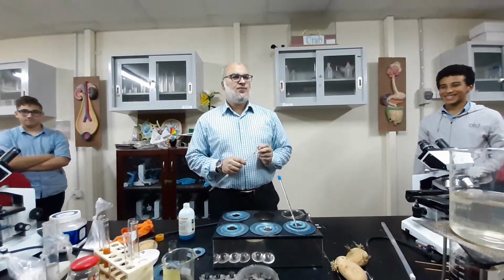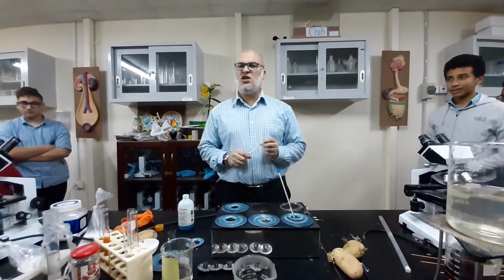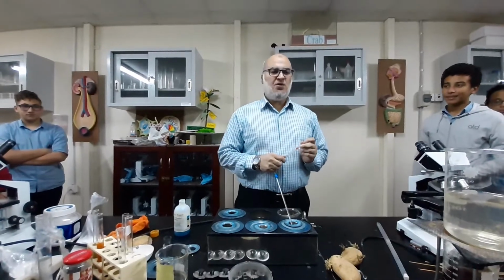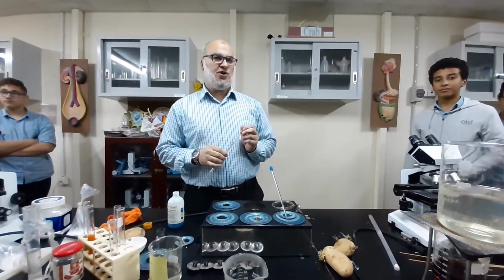Hello guys, today we're going to do an investigation that most students in IGCSE, SAT and IB, whatever curricula, are using. This test is the test for the reducing sugar.